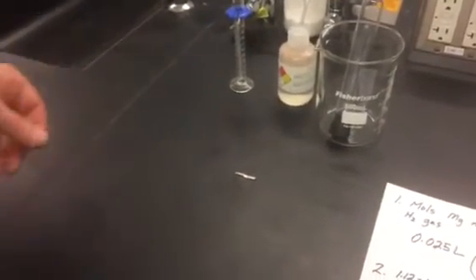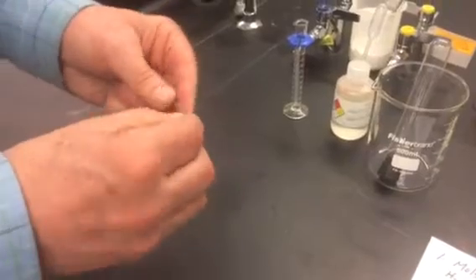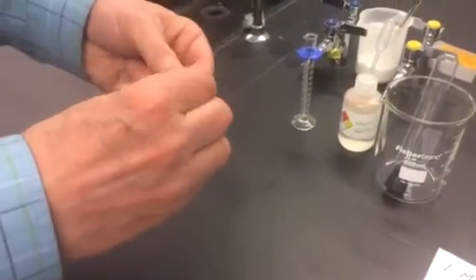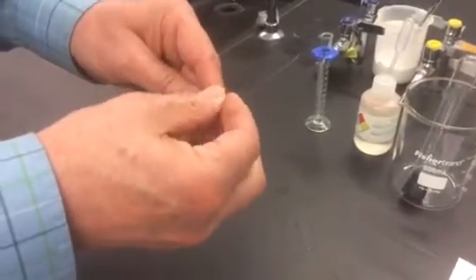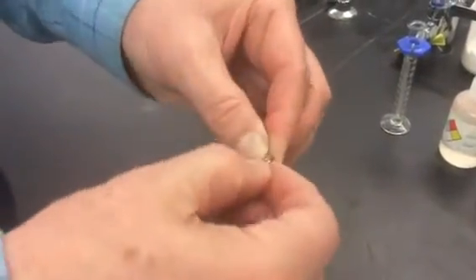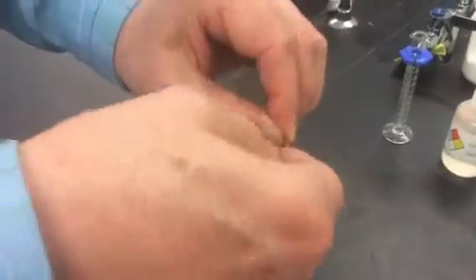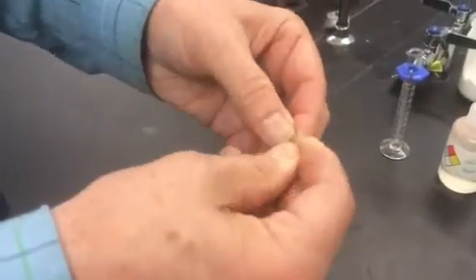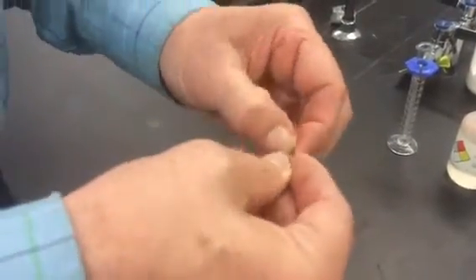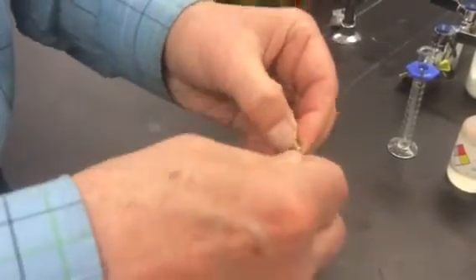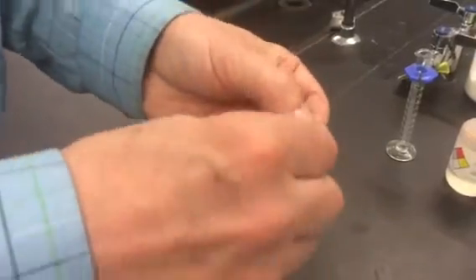then you're told to build a copper cage for the ribbon using a thin piece of copper wire. Most students fold the ribbon at least once, sometimes fold it even more than once, twice, and then kind of wrap that thin piece of copper around your magnesium ribbon. You're trying to keep the ribbon from escaping the cage until the very end of the reaction, so it doesn't float to the top of your test tube and stick to the side and fail to completely react. So you just wrap that copper wire around there until you're sort of happy with what it looks like as a cage, and then proceed to the next step.